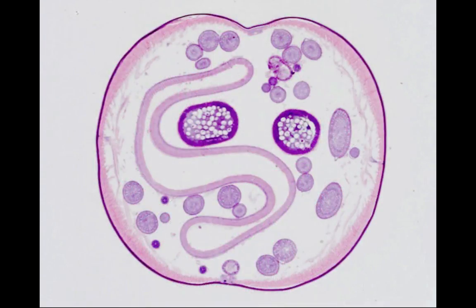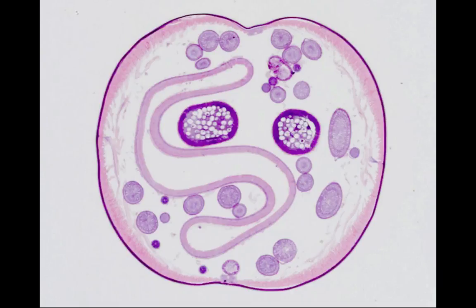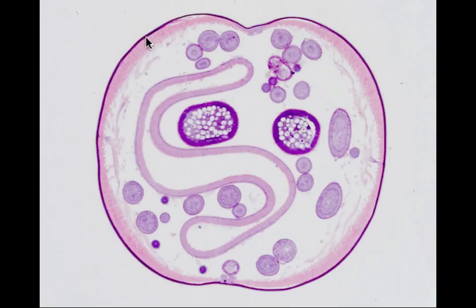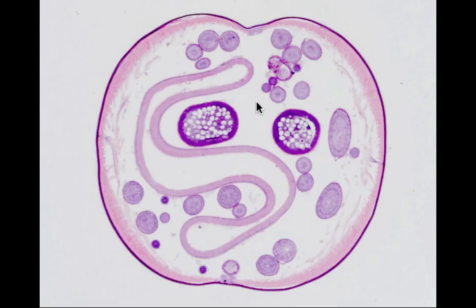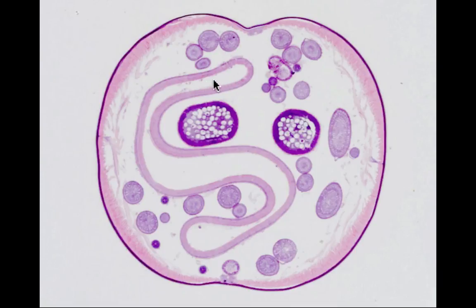If we compare the male with the cross-section of a female Ascaris, we find that most of the structures are the same. You can see the cuticle, the epidermis, the longitudinal muscle, the pseudocoelom, or hemocele, and the intestine.